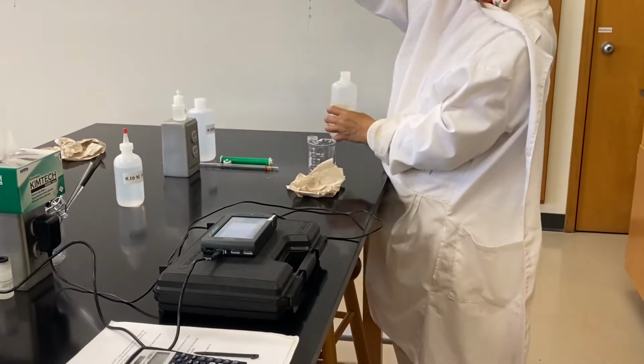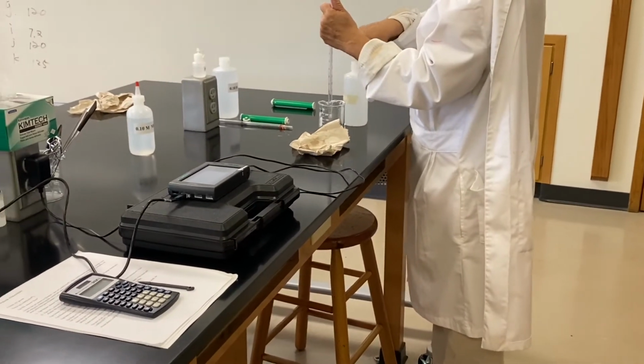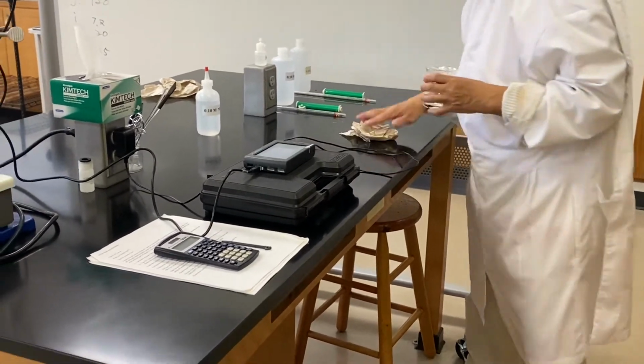Now, beautiful. And return. Okay. Yeah, you see, there's still some. We don't care.